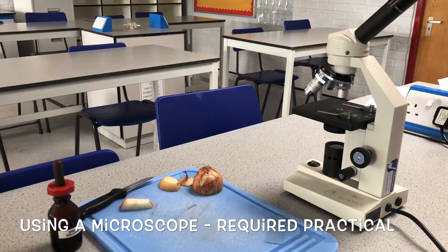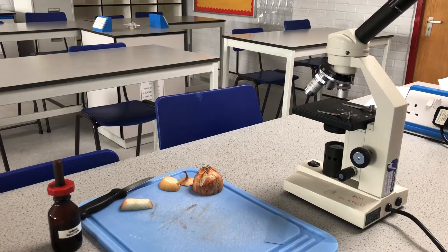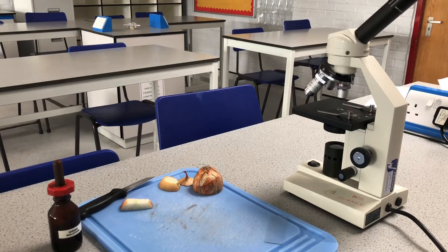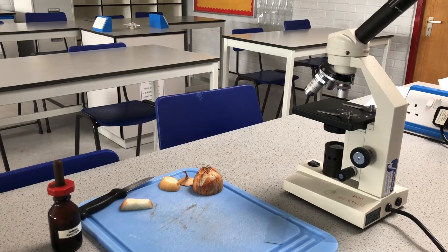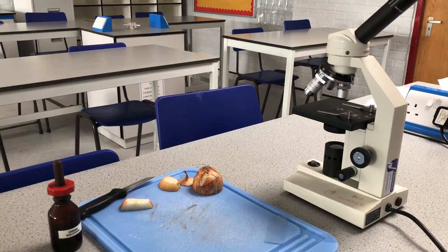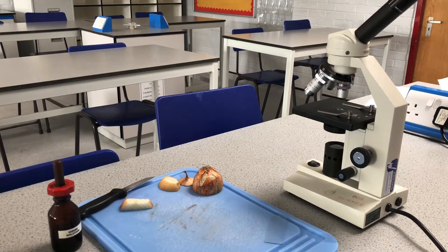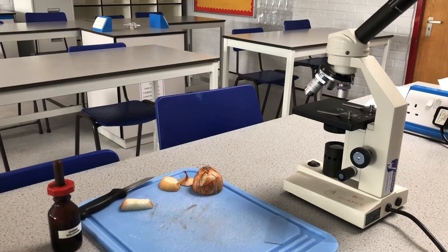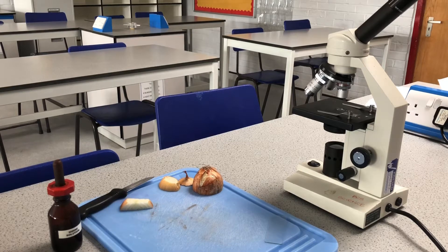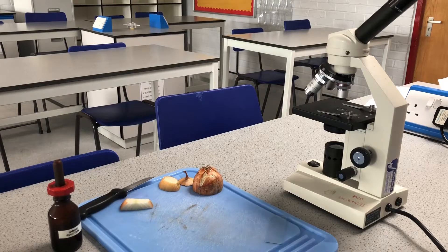Hello and welcome to this video about using a microscope. It is a required practical for GCSE in topic B1. It can also be used by anyone looking at using a microscope, and it's used in the cells lesson in year 7 as well. I'm going to talk through the microscope, how we make a slide, and how we view that slide.